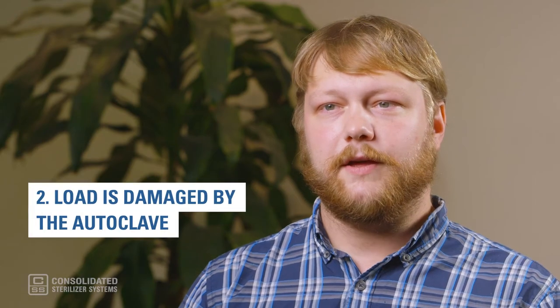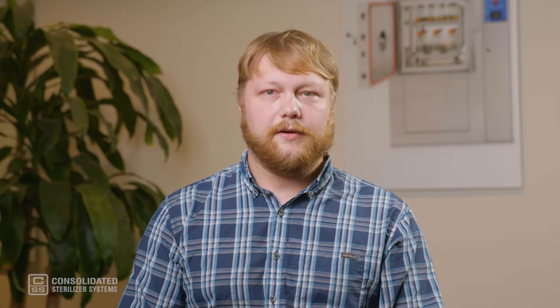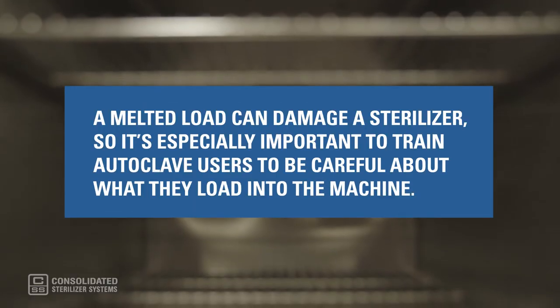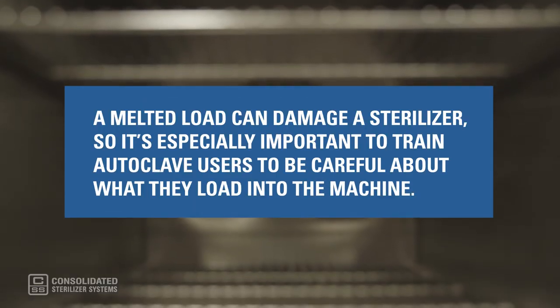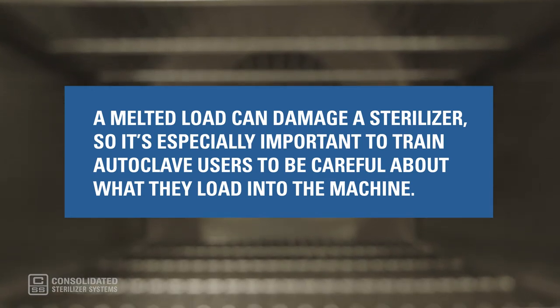Problem number two: the load is damaged by the autoclave. Autoclaves run at very high temperatures, which is why it's important to ensure that any items loaded into a sterilizer are autoclave safe. Most laboratory equipment will say whether it's autoclave safe or list its melting point. A melted load can damage a sterilizer, so it's especially important to train autoclave users to be careful about what they load into the machine.